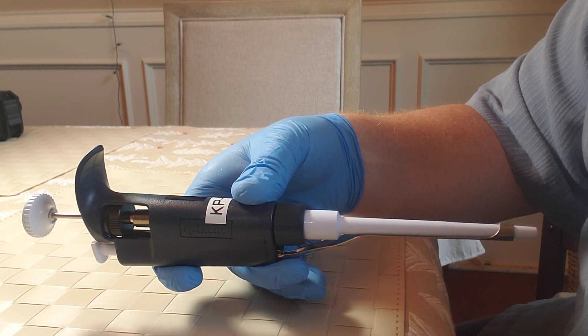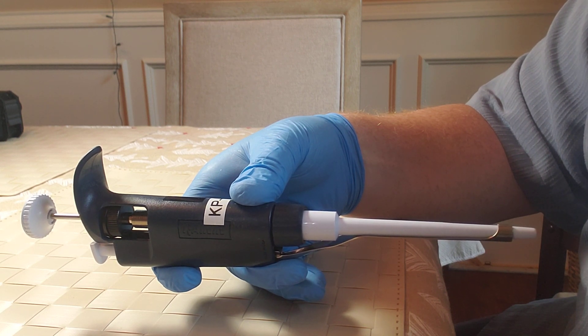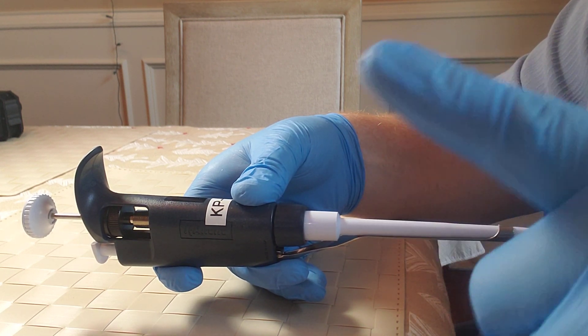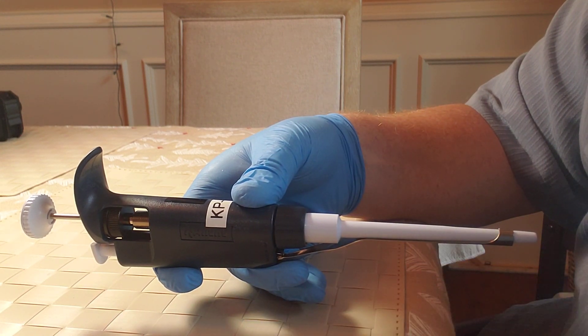Warning: the calibration adjustment process should always be the last option, never the first, second, or third choice. Always the last option. Why?